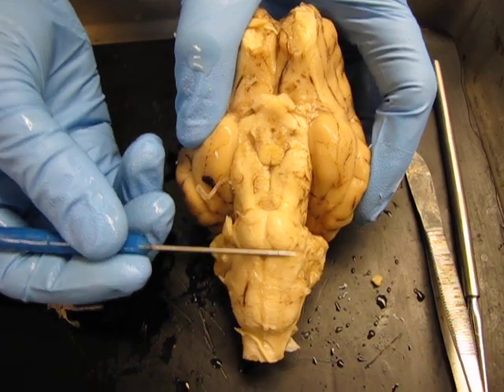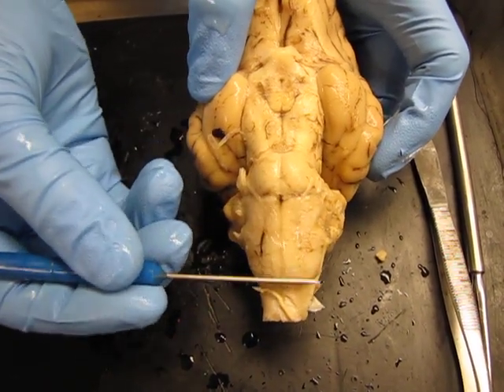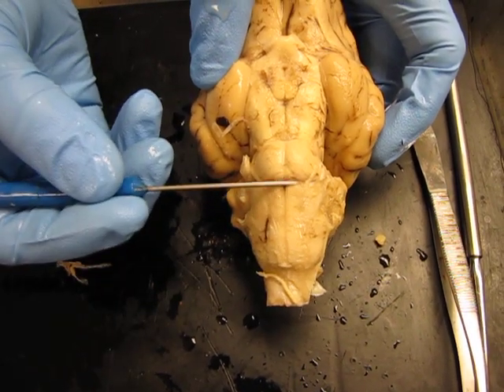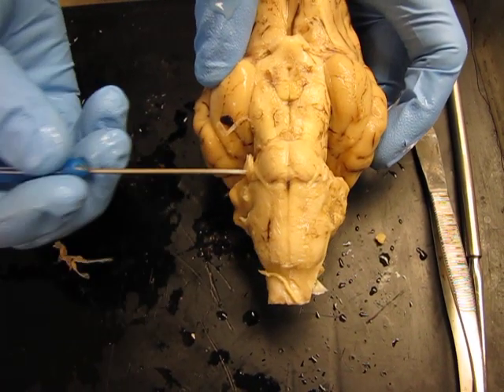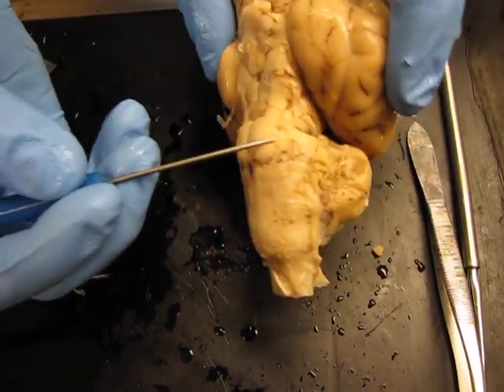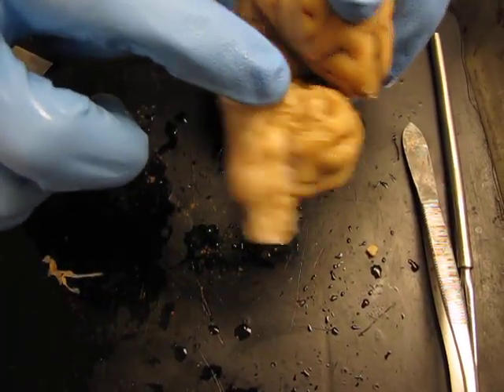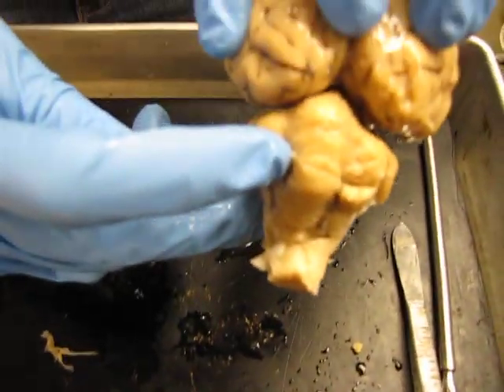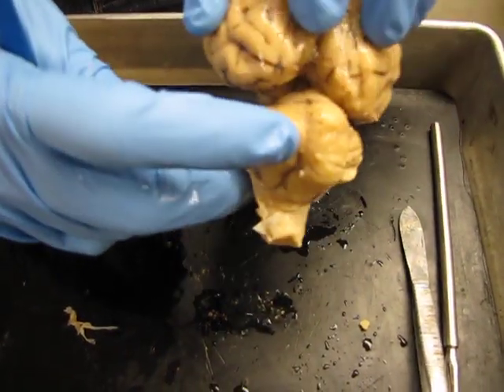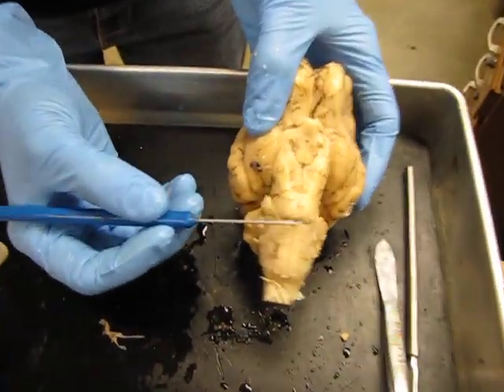This bump, part of the brain stem, is called the pons, and then this last, much longer bump on the sheep brain is called the medulla oblongata. The pons also helps connect the brain stem to the cerebellum — you can sort of see how it rolls up to connect to the cerebellum. The word pons means bridge.